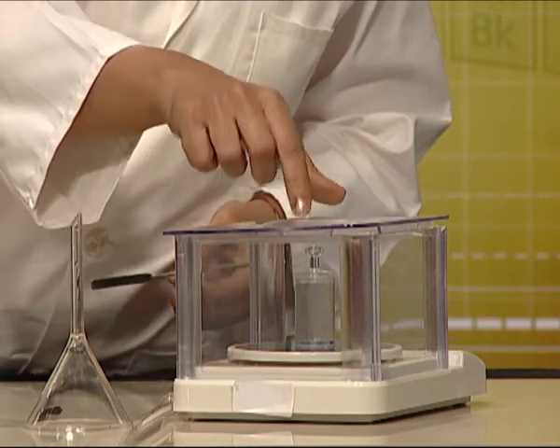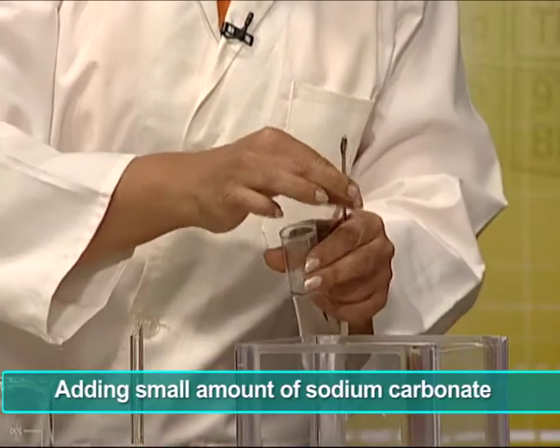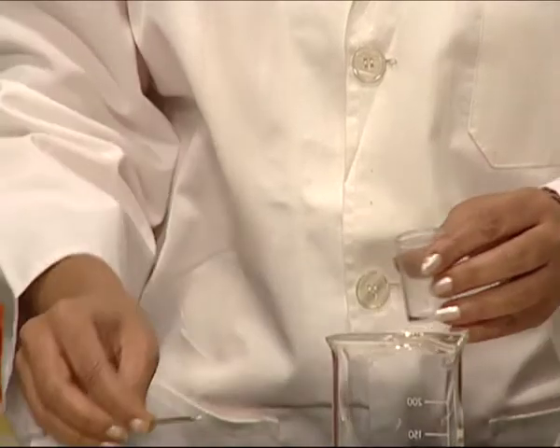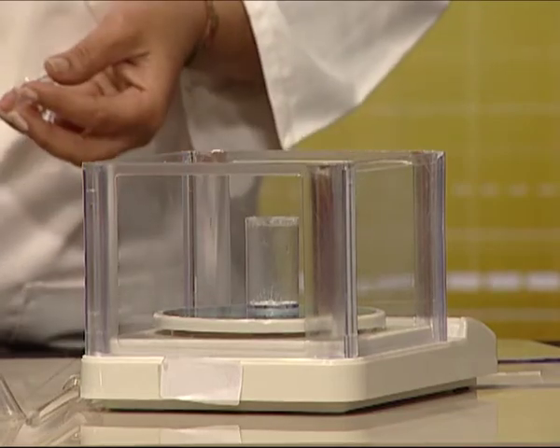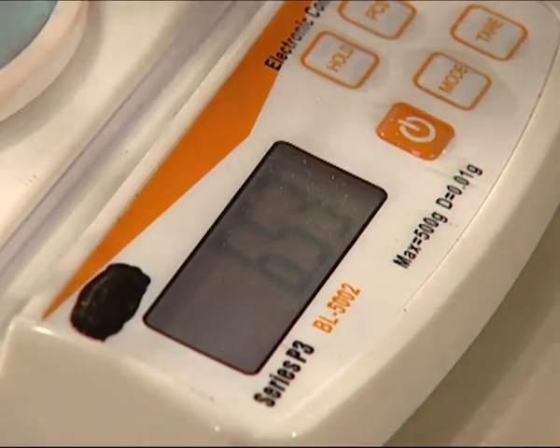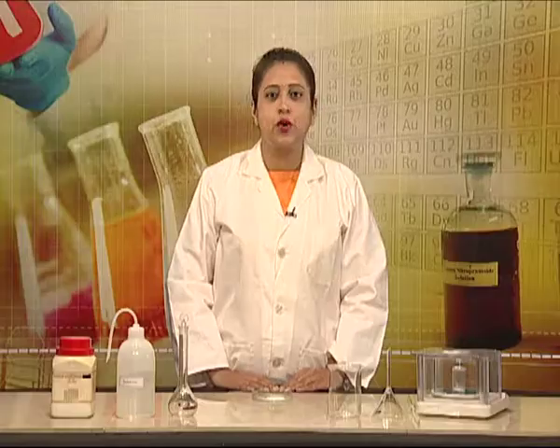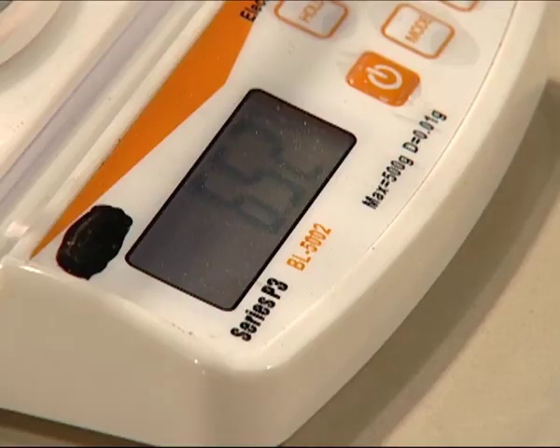Now we shall remove the bottle, remove its lid, and add a small amount of salt. The required amount of salt — 0.53 gram — is already taken in the weighing bottle. The initial reading was 5.99 grams and after adding the salt it has become 6.52 grams.